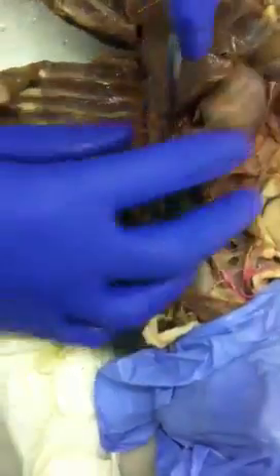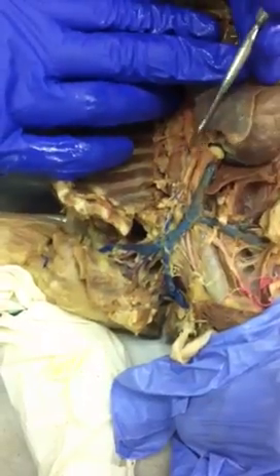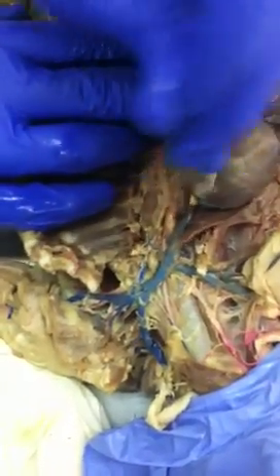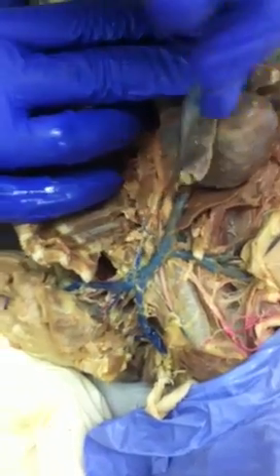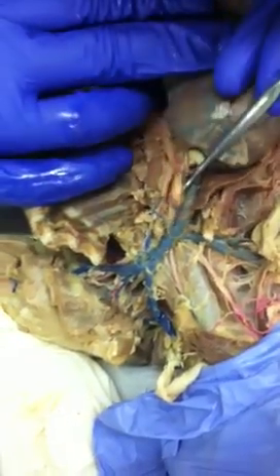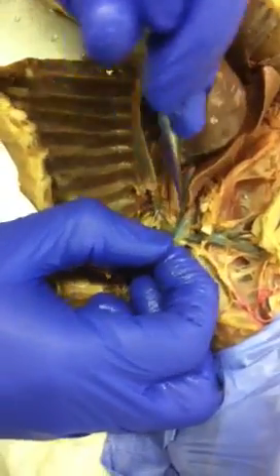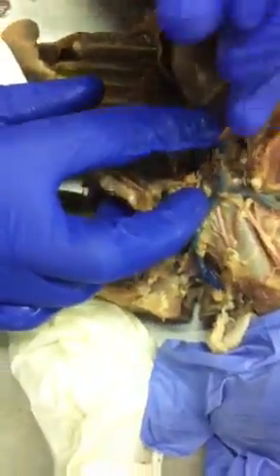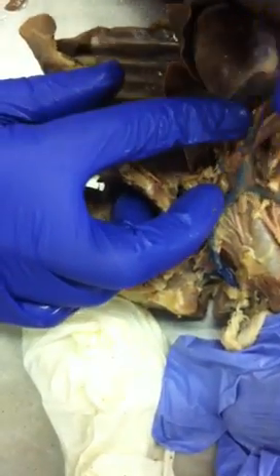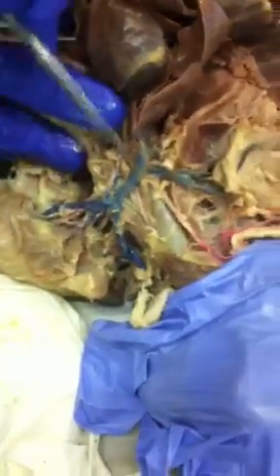Okay, so the basic rundown of the vessels. This is the aortic arch right here. So you have two branches off of here, brachiocephalic and left subclavian. The brachiocephalic branches into three different things. First, the carotids, so you have left and right carotids, and then the right subclavian, the third one right under here. So this goes towards the arm, and the veins run the same way.